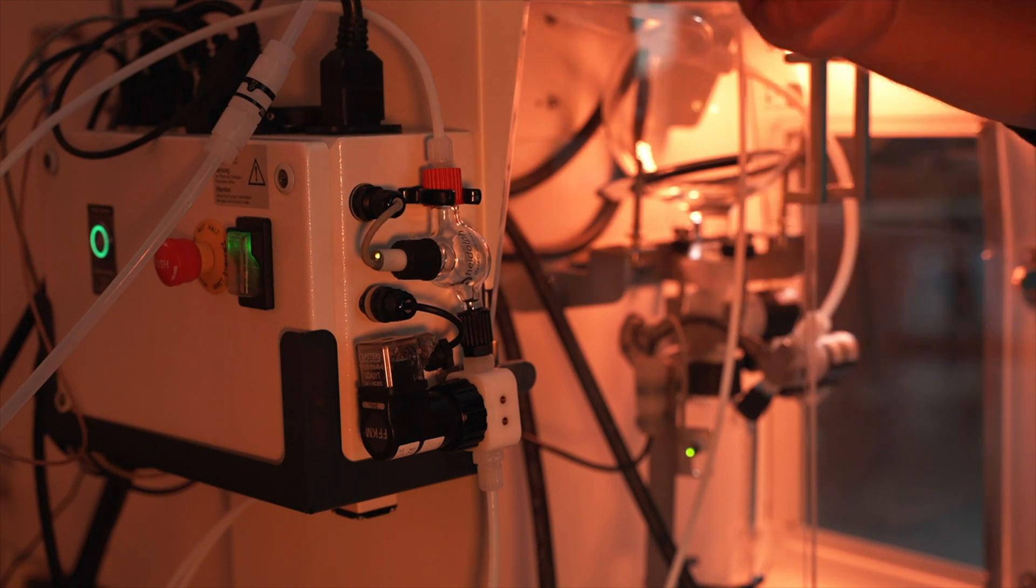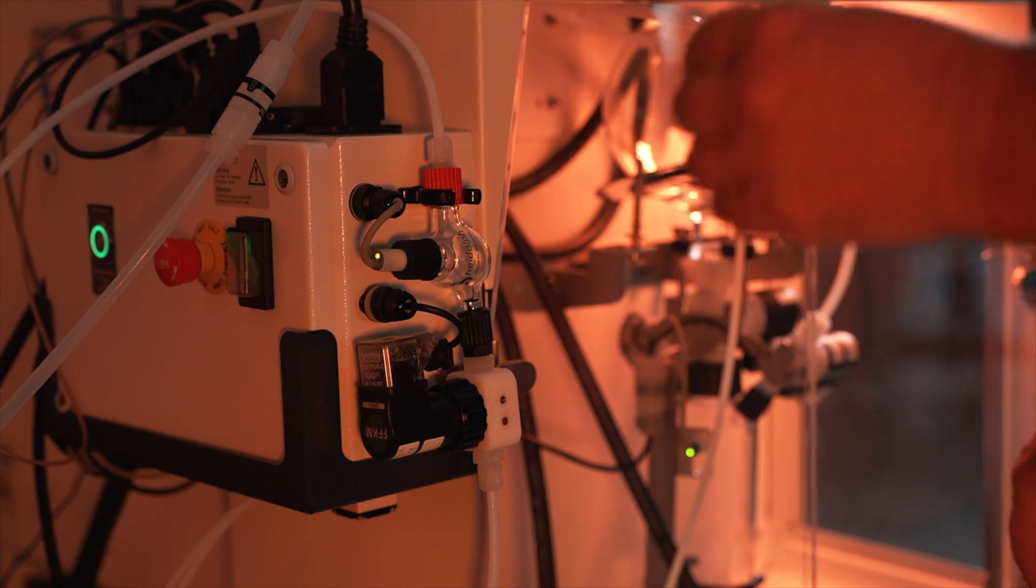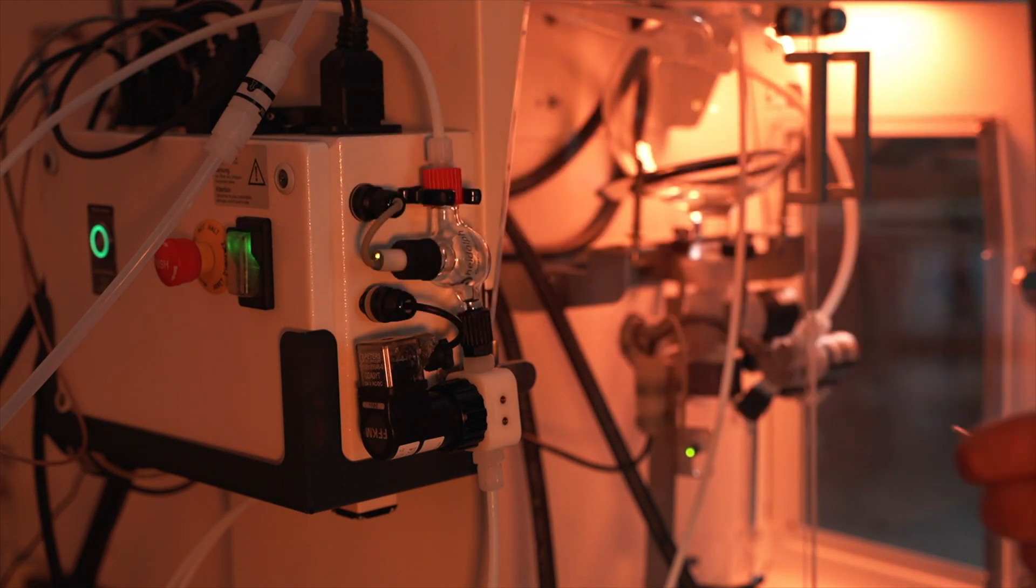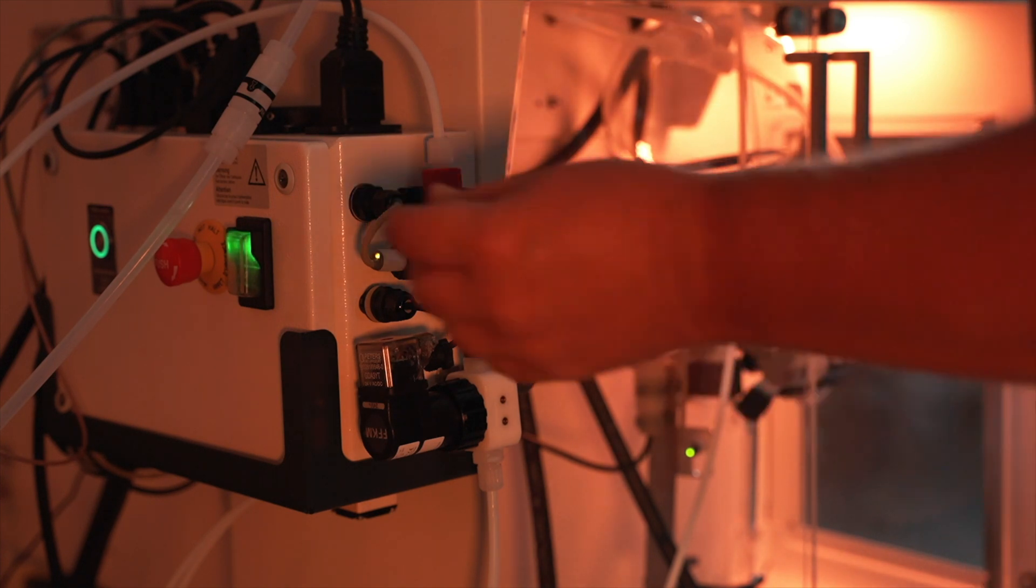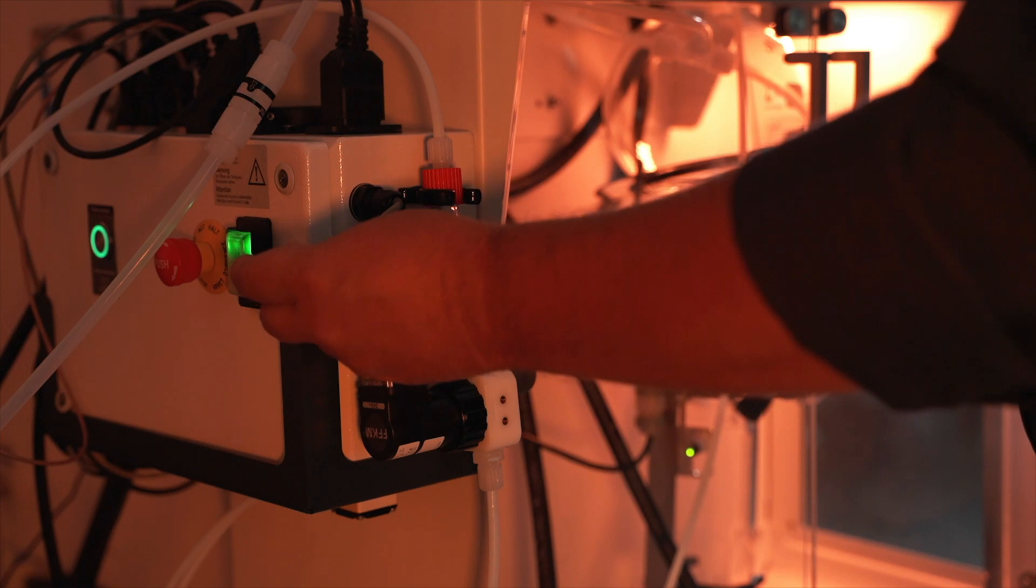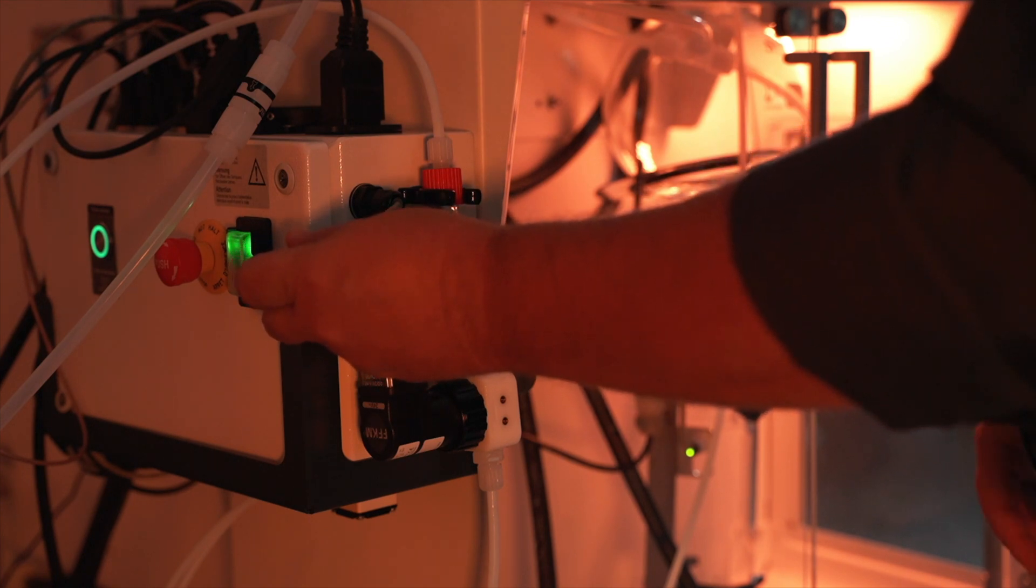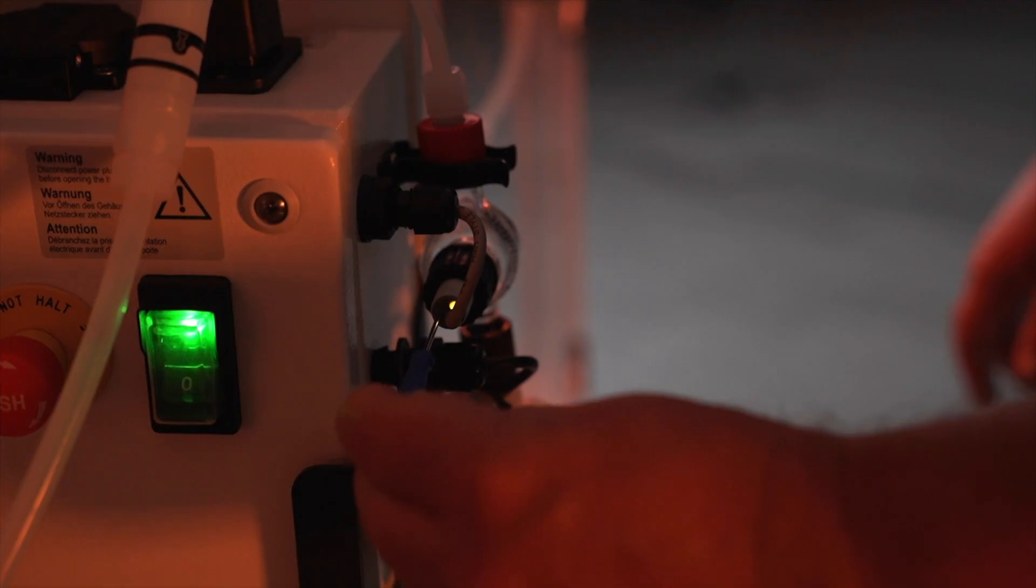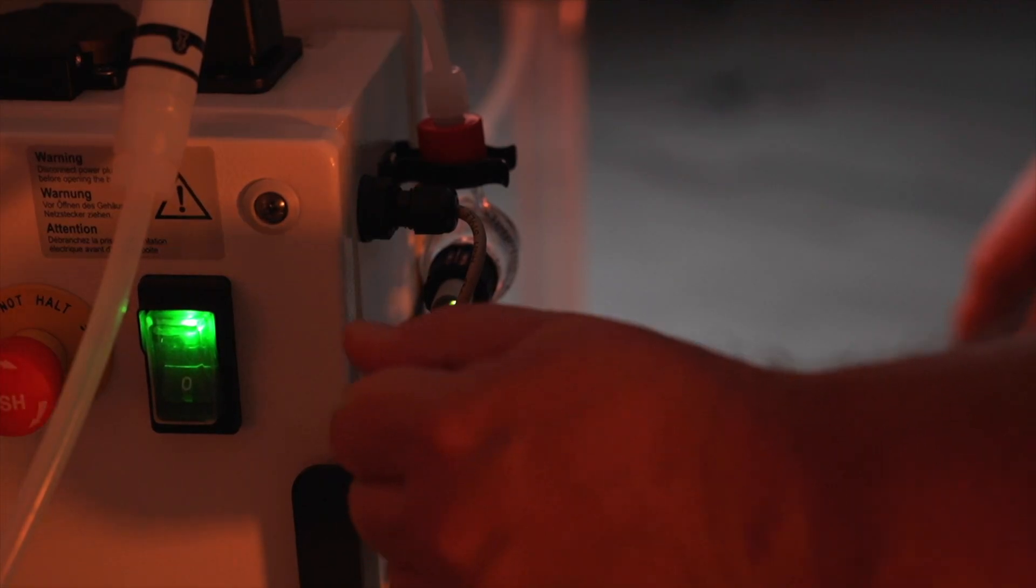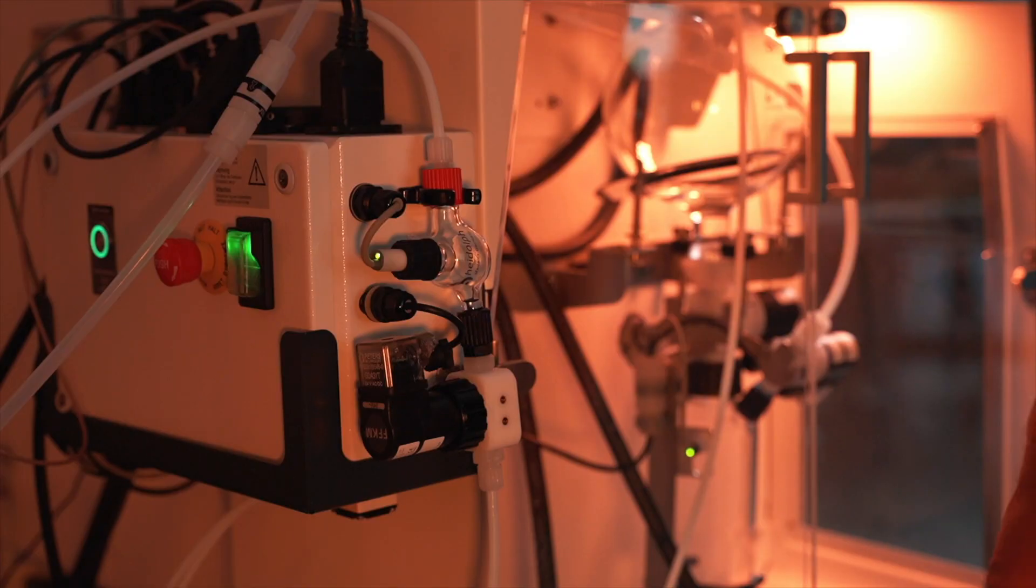Now during your process if you still have plenty of supply left and you still see that message, again it's very possible that the sensor here just needs to be adjusted. So with that you'll see that it's amber. If the vessel is full it should be amber but if it's green and full you don't want that at all. So again get the screwdriver in there and then tweak it to the desired location.